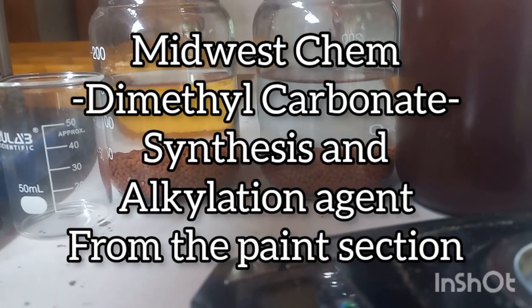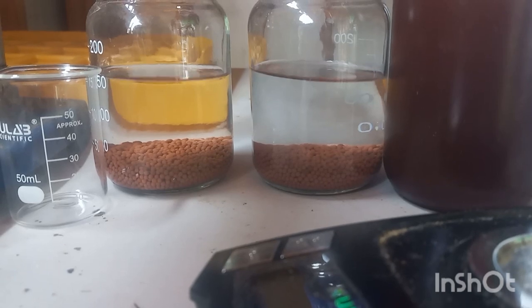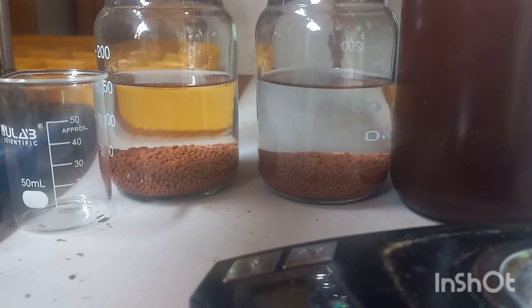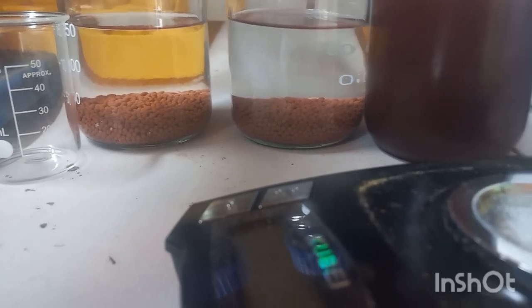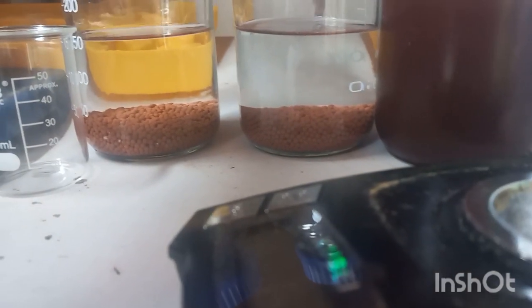Alright guys, Midwest Cam back at it again, and we're going to do dimethyl carbonate this time. We're going to do this by transesterification of propylene carbonate, which I've synthesized, and we will show you that in a moment. For now, we have our anhydrous methanol, about 350 mL.